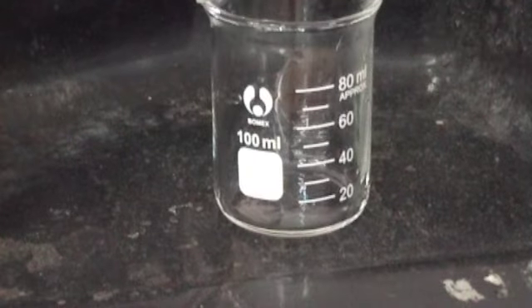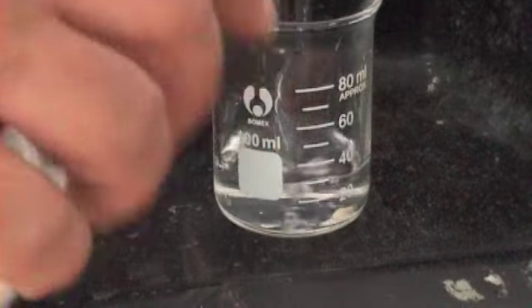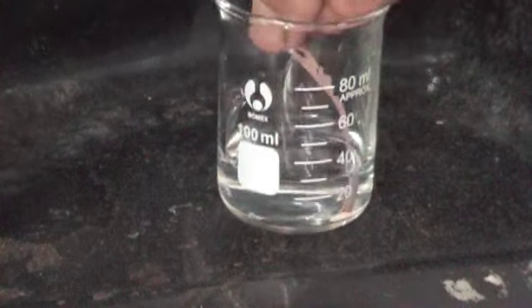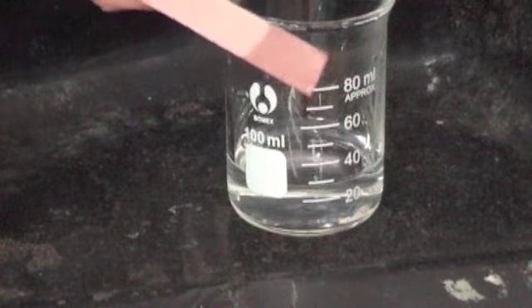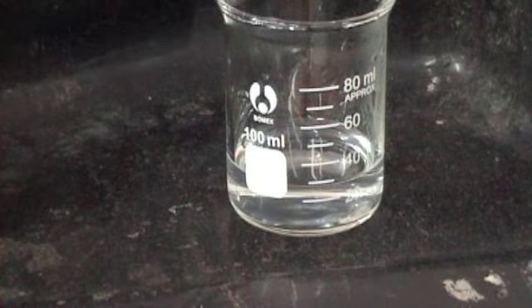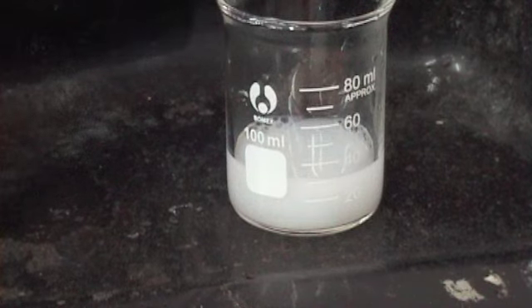Yeah. Yes, alright. Okay, so now we've got to do the litmus test again. We're doing anion now, right? Okay, so this is very repetitive, this one, isn't it? Because, once again... No change. Okay, no change, still red. Alright, and then we use our barium nitrate and we get, ta-da, our precipitate. Okay, so that shows us that the zinc was the cation and sulfate was the anion. Zinc sulfate, alright?